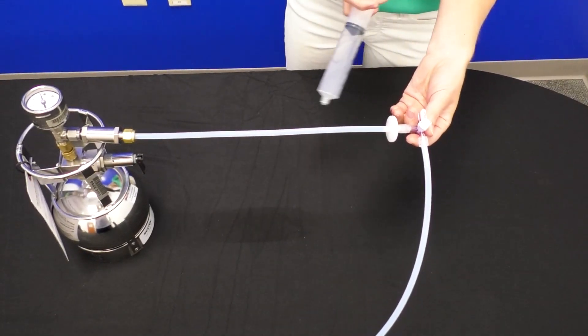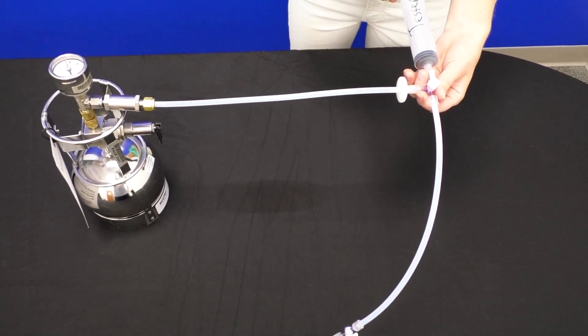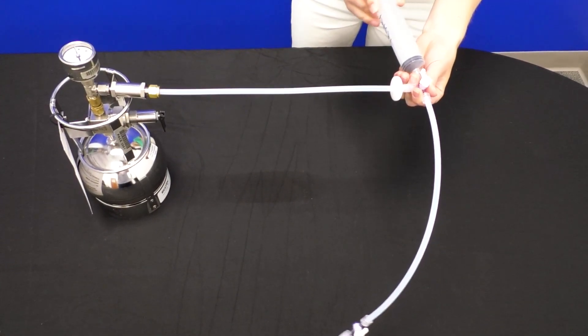Otherwise, you draw air into your line through that valve. And that's it. Good luck sampling!